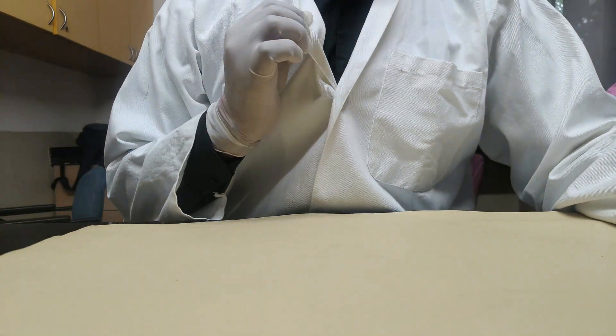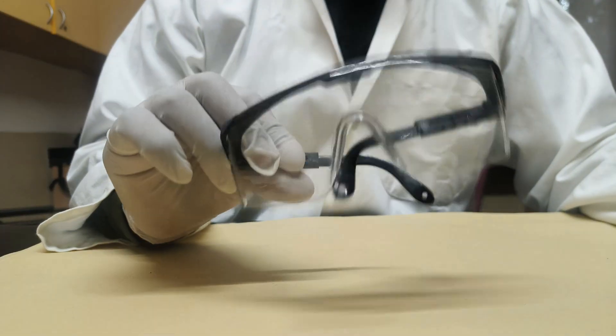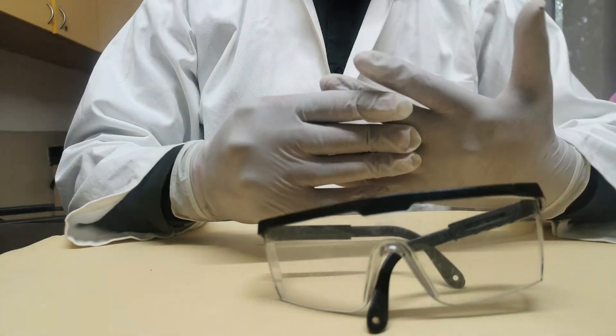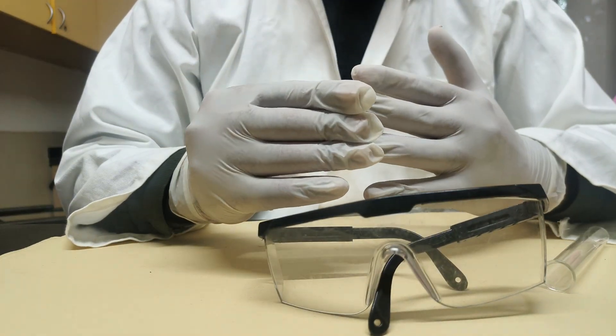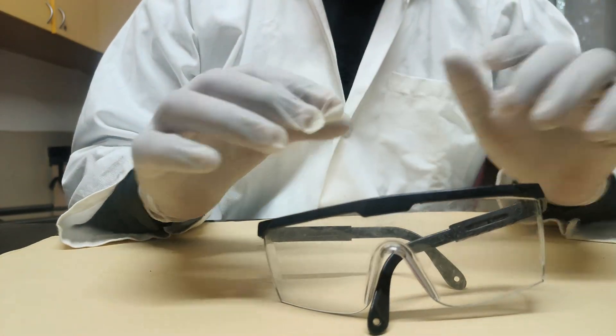Whatever I am wearing is known as a lab coat — it is used to keep us safe. Next is goggles, and the third one is gloves. These are basic safety apparatus we should wear before starting any activity in the lab.